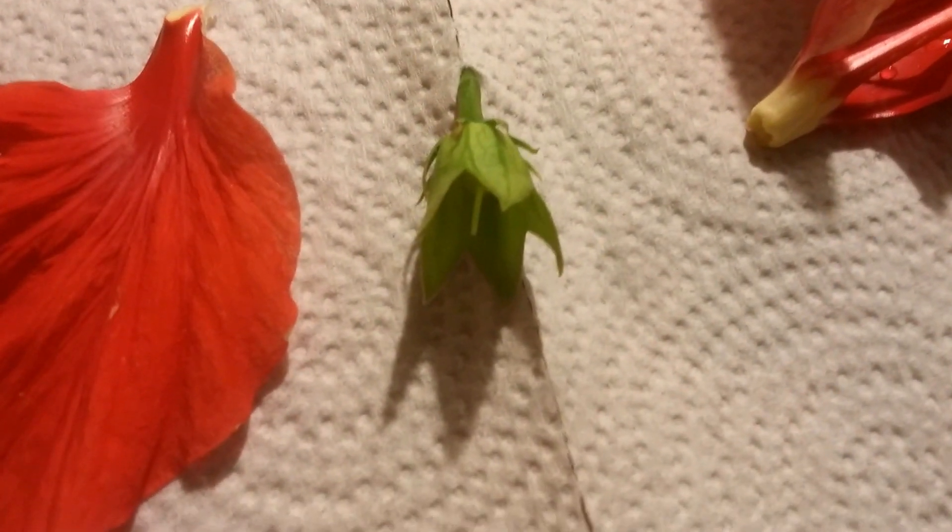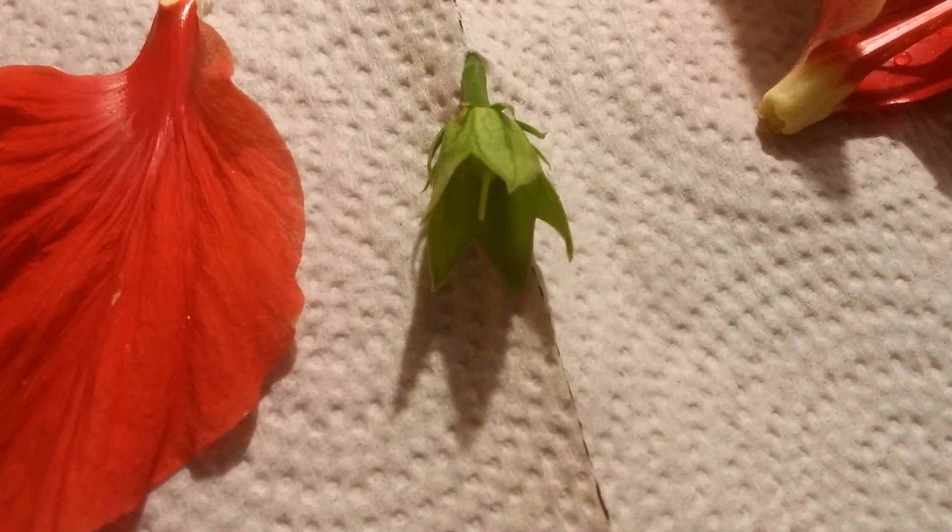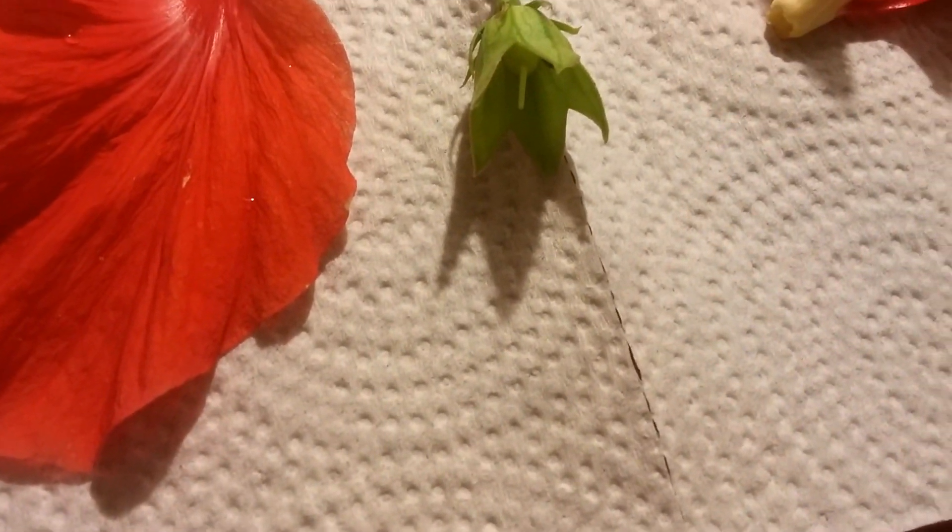So we can start with the sepals. Sepals are green — they're mostly green, but they can be brightly colored. So I wouldn't be surprised if part of the sepal is produced along the petals, which are these red leaves. So the sepals, they're modified leaves that protect the developing flower. So while it was before blooming, this green covered the flower.